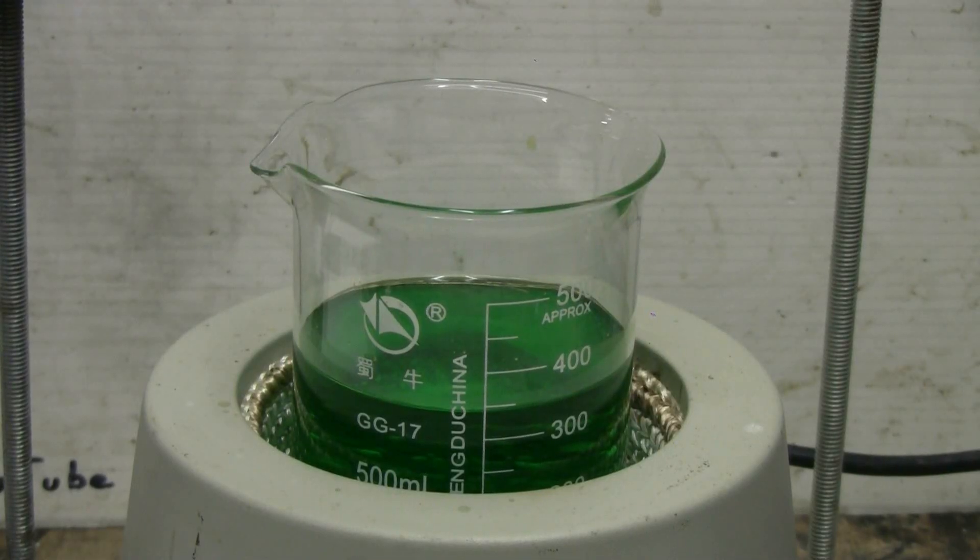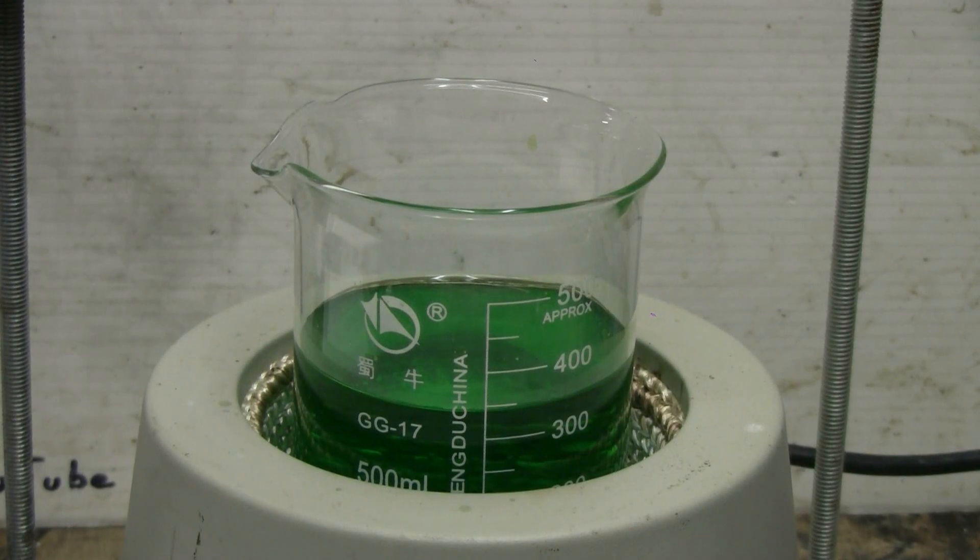I've placed the beaker in my heating mantle and turned on the heat. We'll wait a few minutes for boiling and the chemical change.